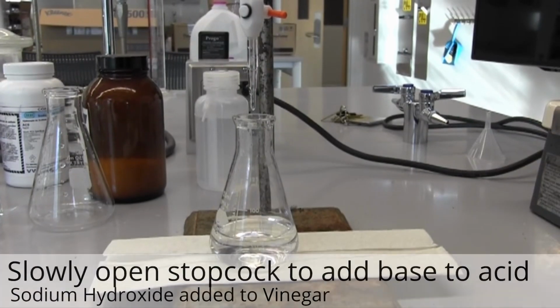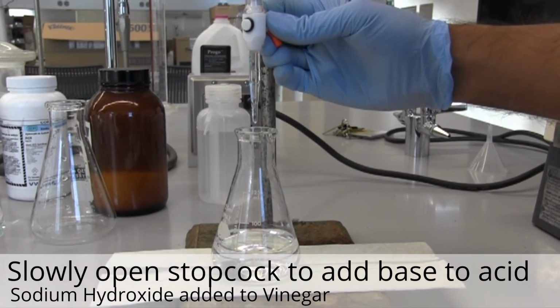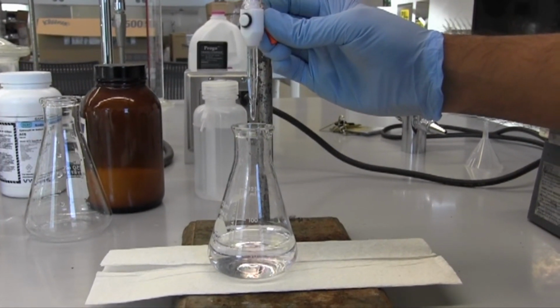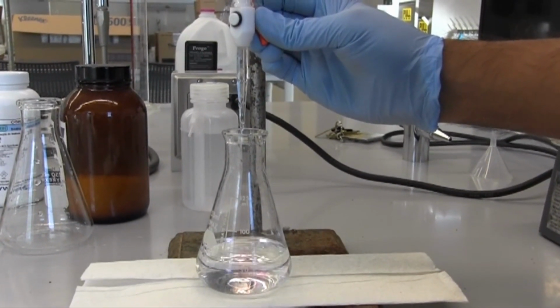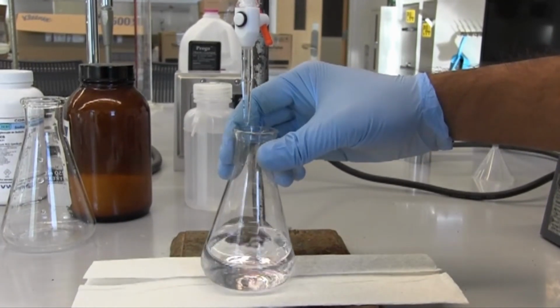And we'll start dropping our base into our acid again. So the stopcock has the same sodium hydroxide that now we know the molarity of. We'll start dropping it slowly into our solution of acid, or vinegar.